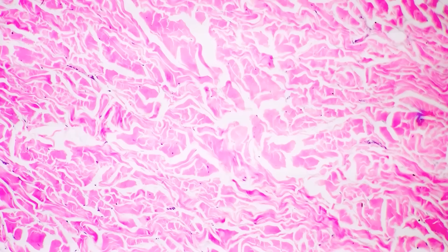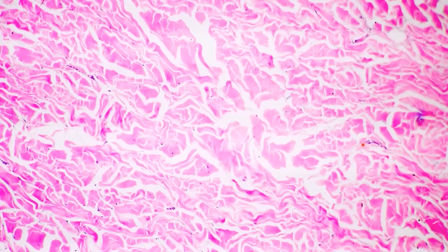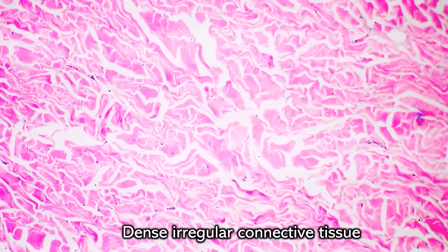This very much looks like hamburger meat. What you're seeing is fibers going in all different directions that have been cut. That's how you know that you're looking at dense irregular connective tissue.